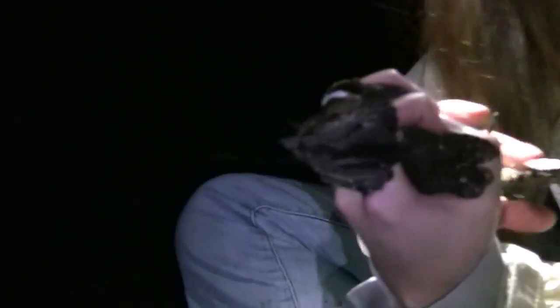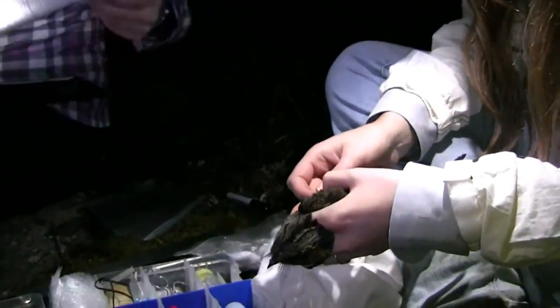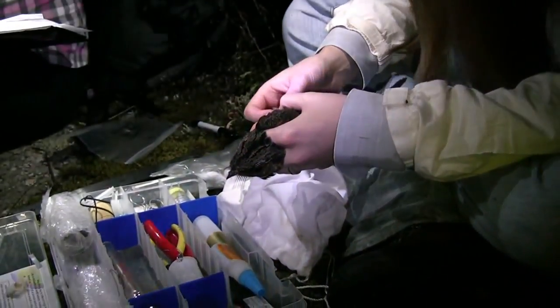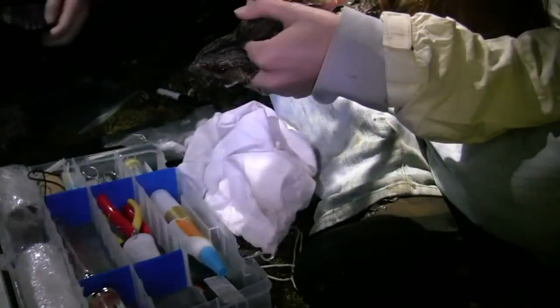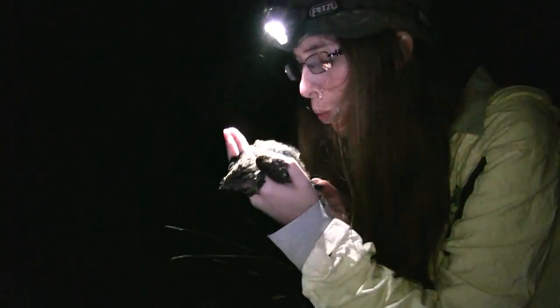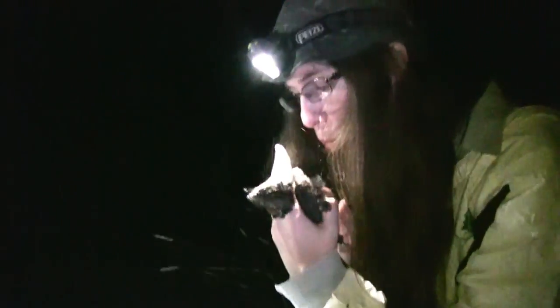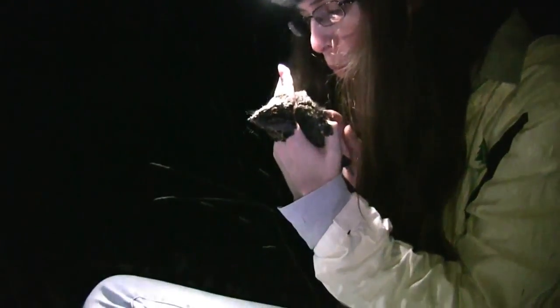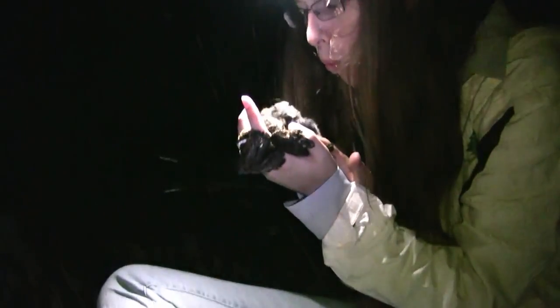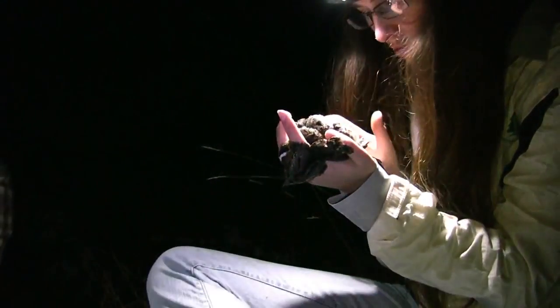Well, you will figure out why. Maybe. Do you want to do these? I think it's just two and I can do that after. And molting stuff — like featherware. Body molt, I would say, is four. Zero fat. Zero brood patch.